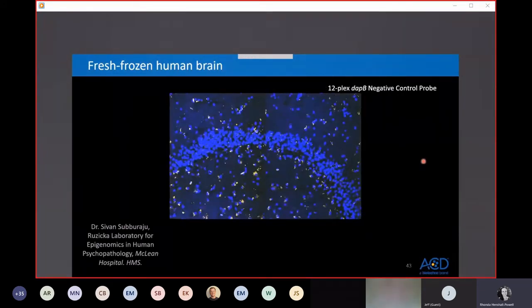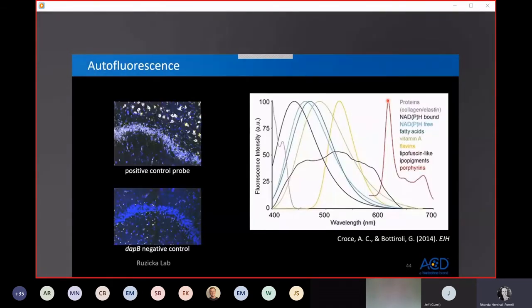This is the negative control probe on a different tissue slide from this same sample. And what you can appreciate here is it looks like there is RNAscope signal, but we know that this is not real RNAscope signal because it's the negative control probe. This signal that we're seeing here is intrinsic to the tissue itself, and it's coming from an autofluorescent molecule called lipofuscin. On the chart on the right here, this brownish line, this sort of broad emission profile corresponds with the emission spectrum of lipofuscin. It just accumulates over time in lysosomes of postmitotic cells, such as neurons or cardiomyocytes, for example. The exact mechanisms of its accumulation are unclear, although it often correlates with aging.